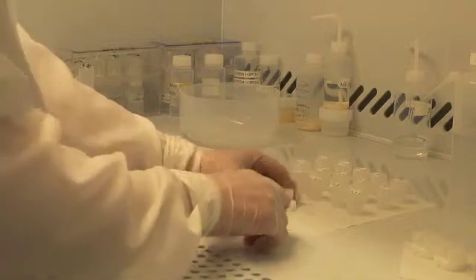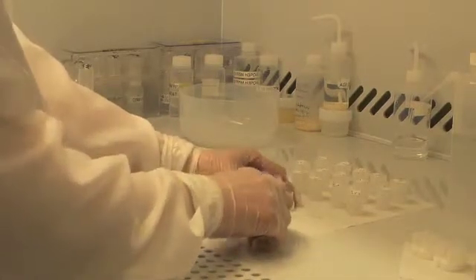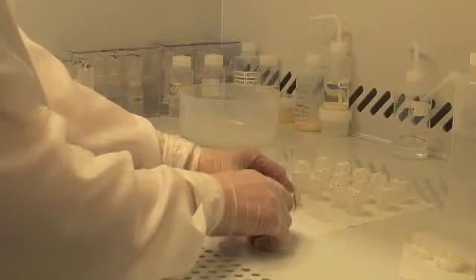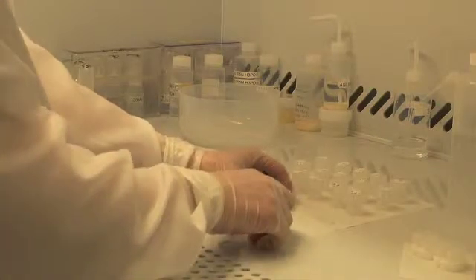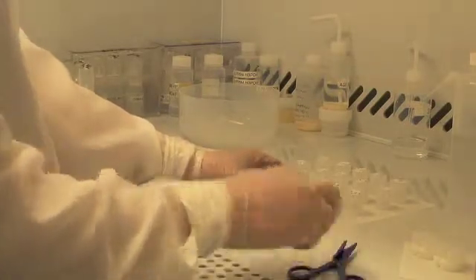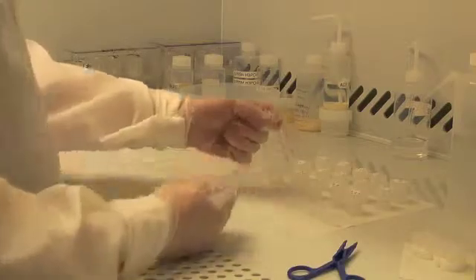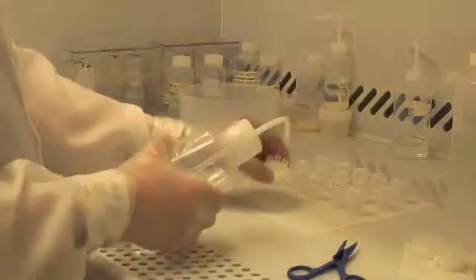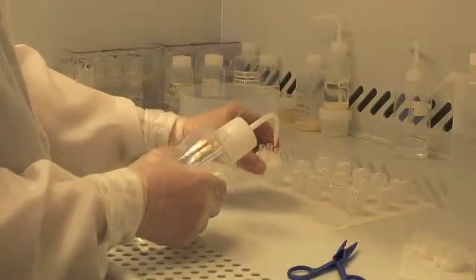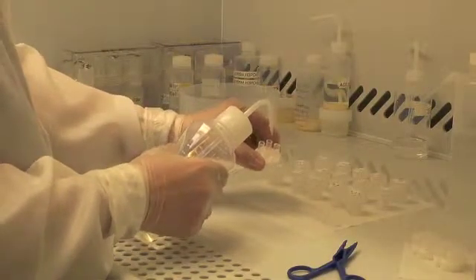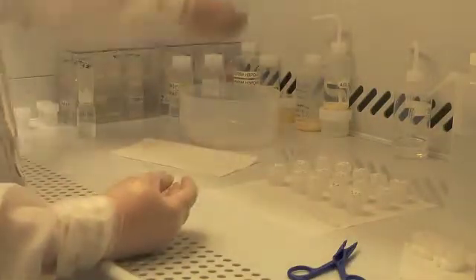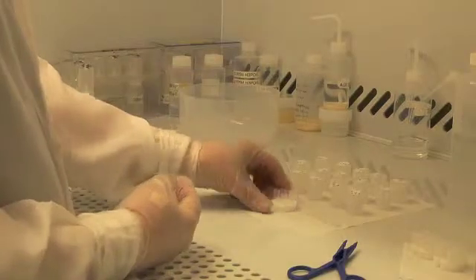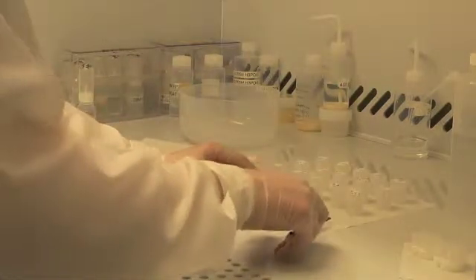While the zircons are cleaning in the sonic bath and on the hot plate, I have been cleaning the microcapsules by putting six molar HCl in them, fluxing them on the hot plate, and now rinsing them with water and discarding that and leaving them dry, ready to receive the zircon after I've rinsed it.